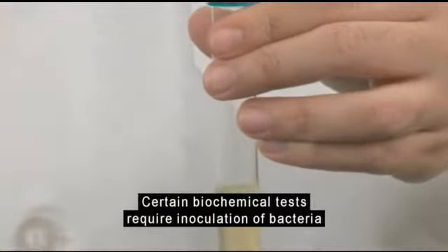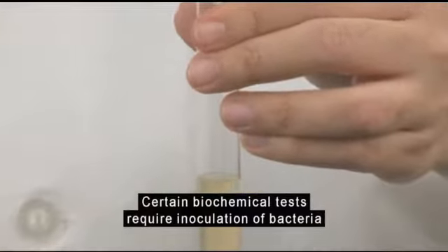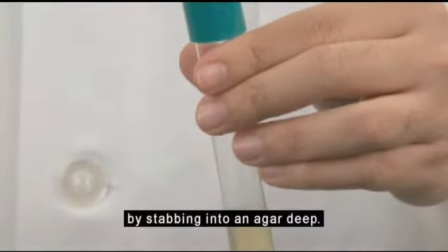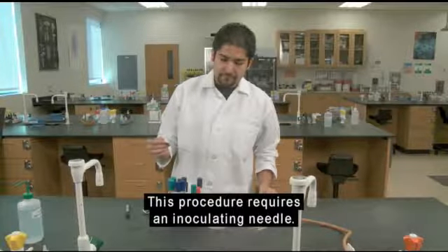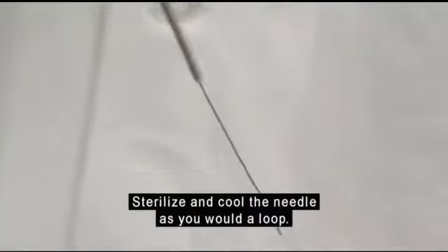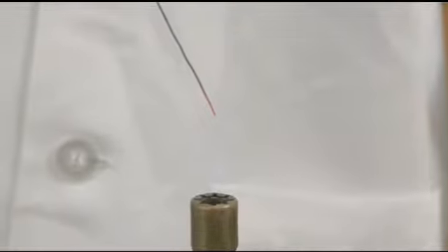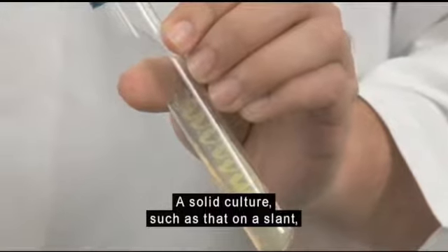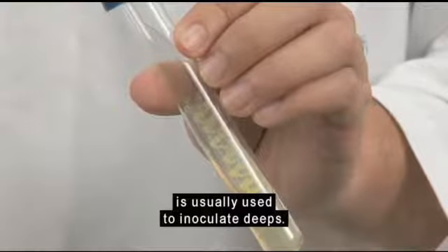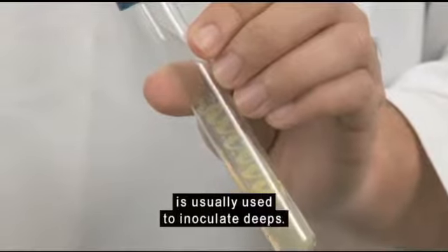Certain biochemical tests require inoculation of bacteria by stabbing into an agar deep. This procedure requires an inoculating needle. Sterilize and cool the needle as you would a loop. A solid culture, such as that on a slant, is usually used to inoculate deeps.